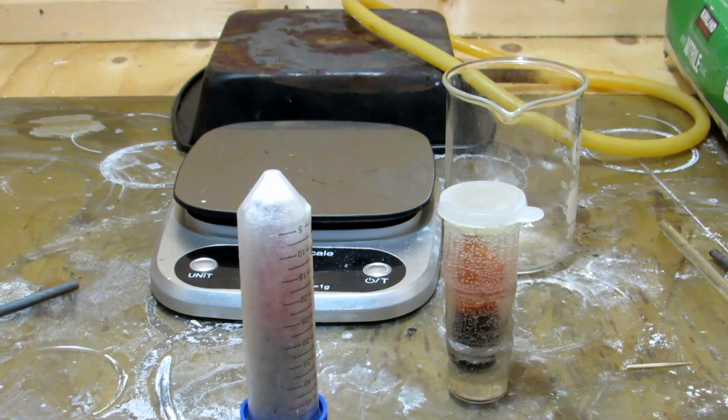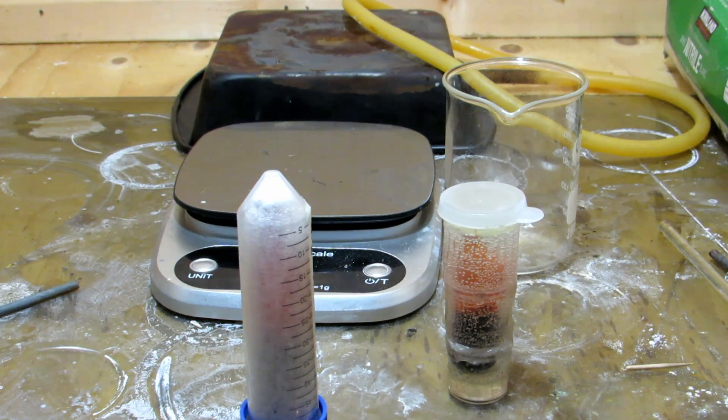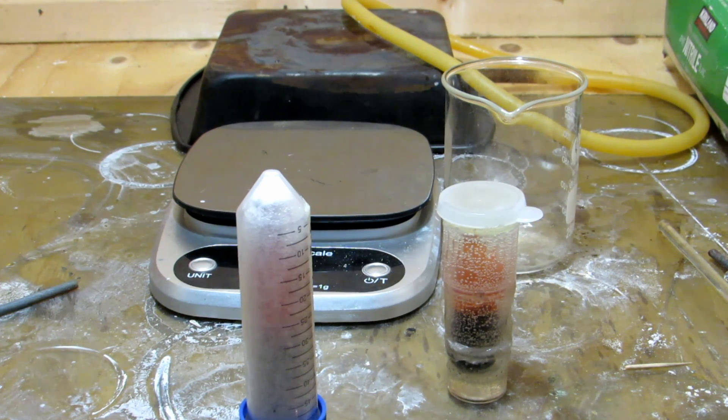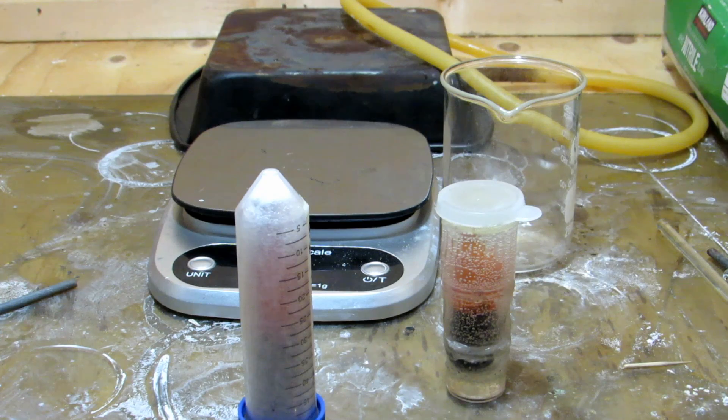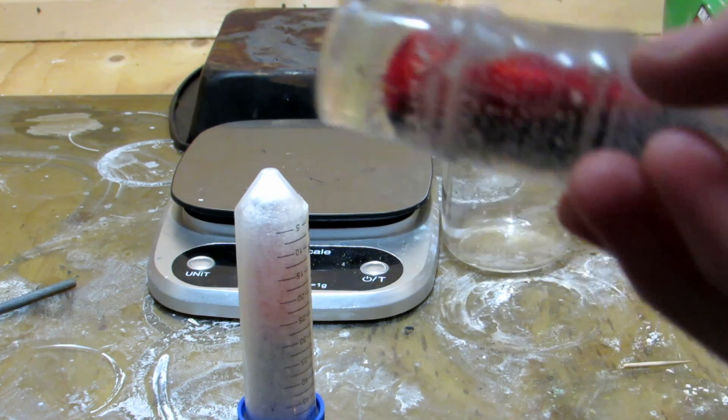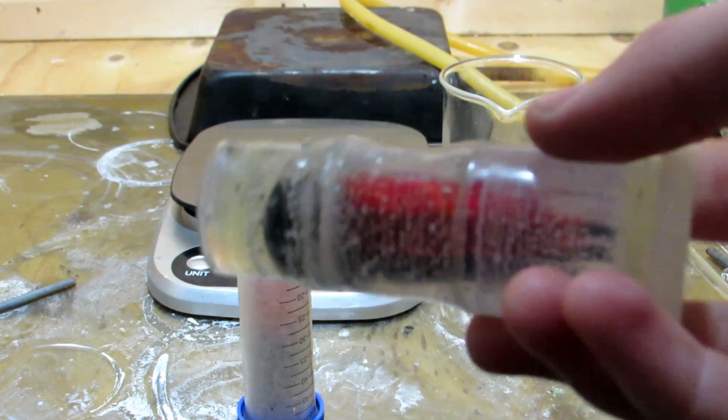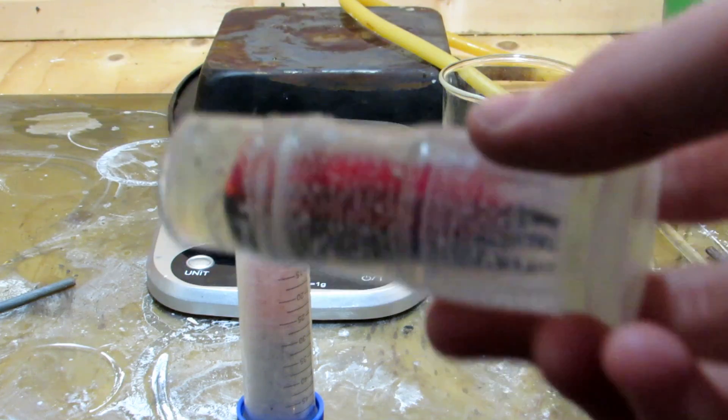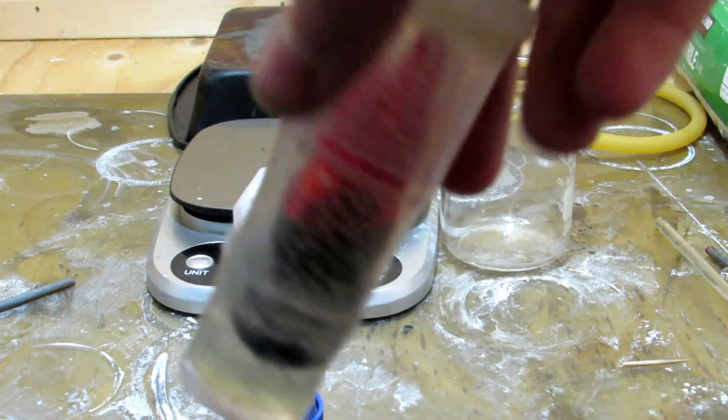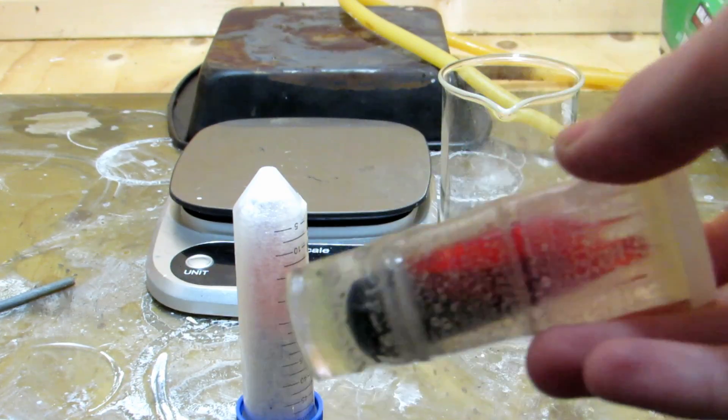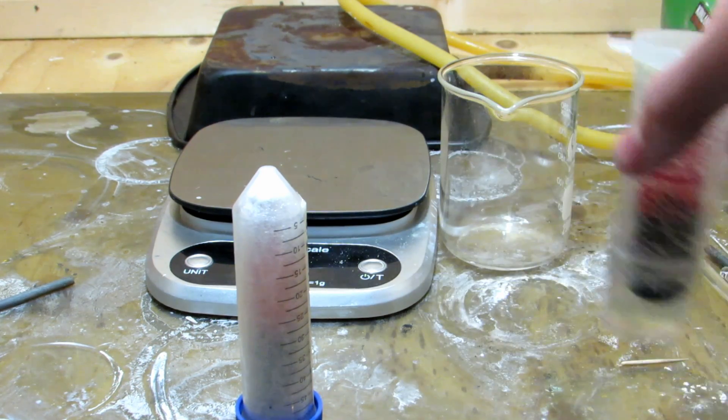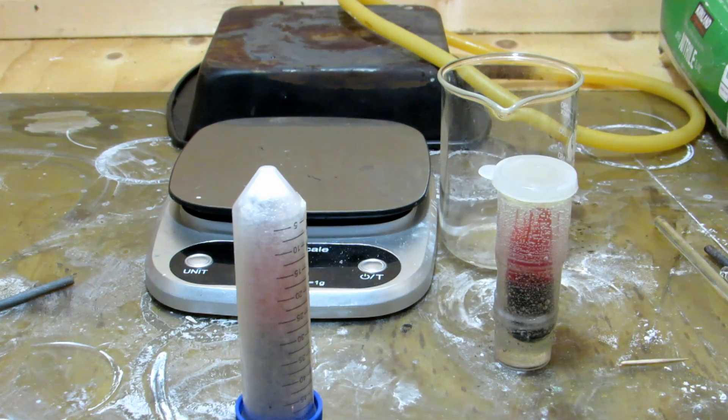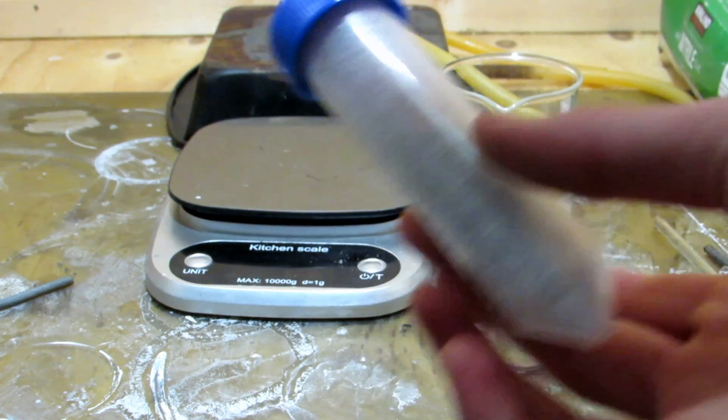Okay so I've transferred all the bromine and it was put into ampoules and then we sealed the ampoules into something that if they were dropped they hopefully wouldn't break as that would be very unfortunate. This one here has a couple bubbles and I'm not totally happy with how it turned out but it's decently good. You can clearly see the bromine inside of there and this is my element sample because this fits inside of my periodic table. I have a spot for each element so that's my element sample of bromine and then in here we have the rest of the bromine.